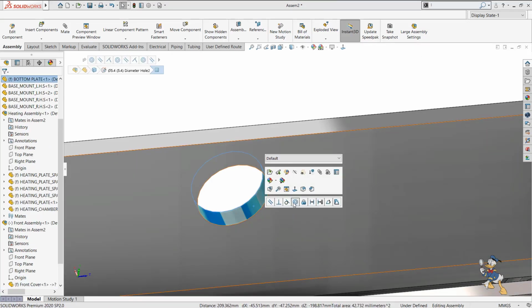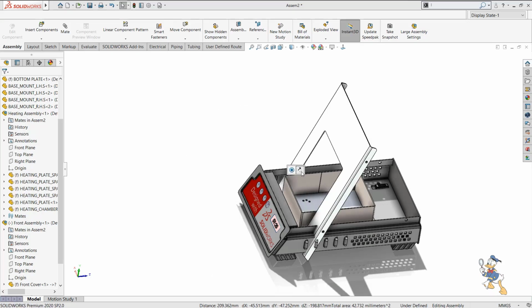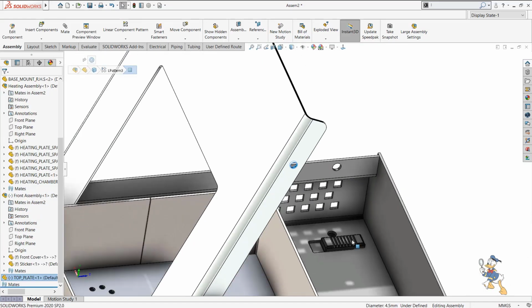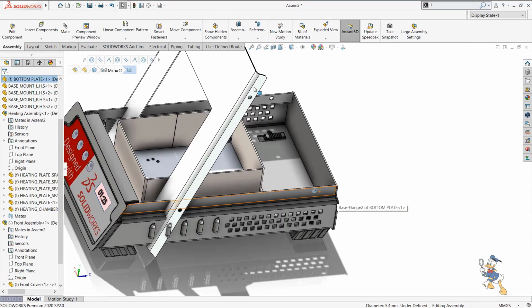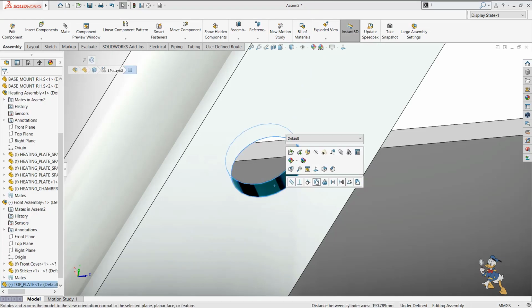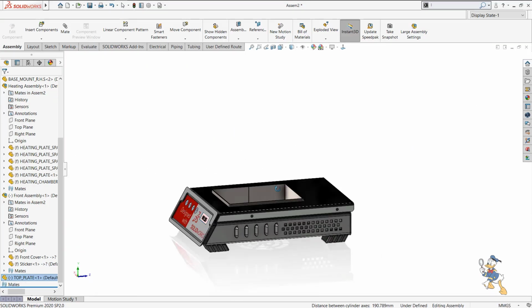So I just need to make it concentric with this feature. It is concentric. I just need to make a reverse concentric of this one. I can make this concentric feature to this one as well. So I just need to check out both faces and make them concentric. So this is how we can place the plate over here.